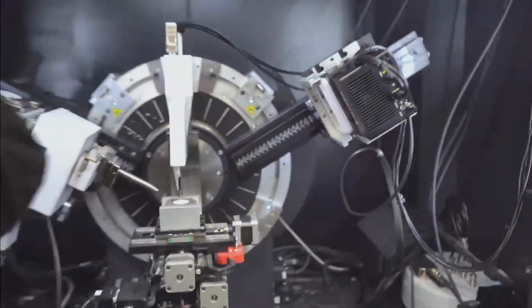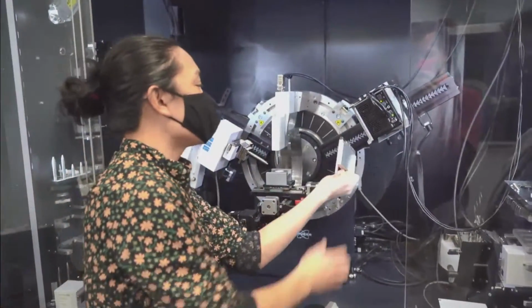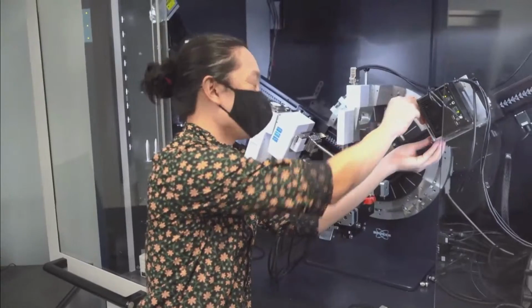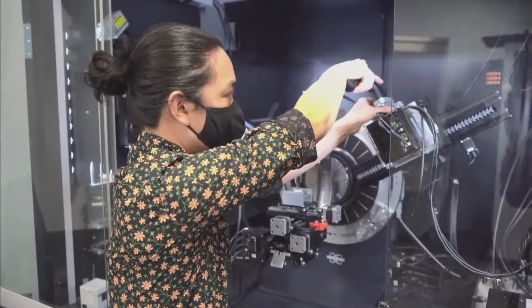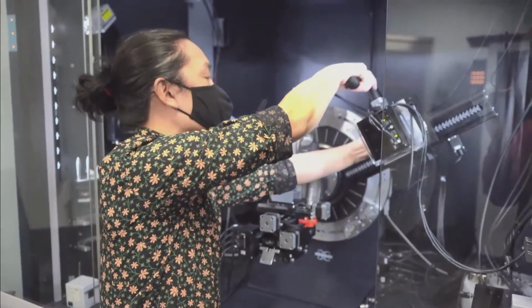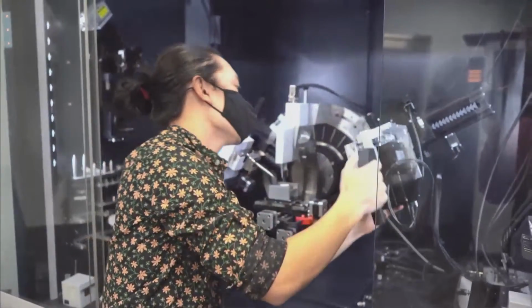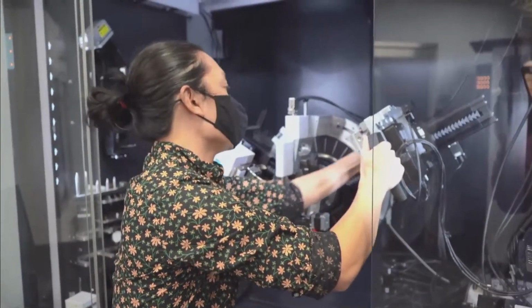Okay. So the easy way to do this, I'm going to put a little shield in there, just to keep me from touching it with my fingers. All right. There's a handle which goes on to the top. Very nice. Easy way to do that. There's a switch in the back which releases the detector. I'm going to rotate it. Okay. And then lock this back on.